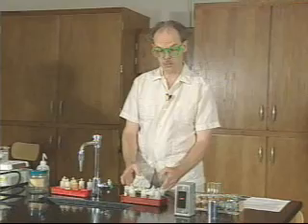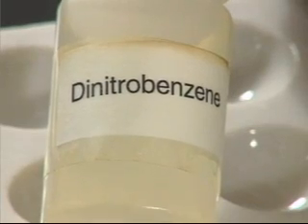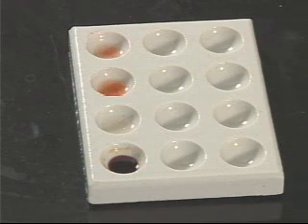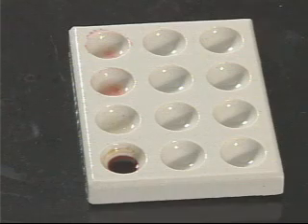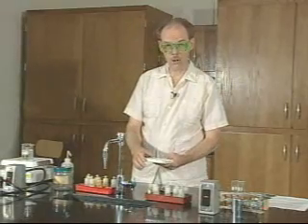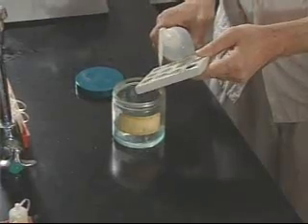At this point there will be no colors visible in your sample. Colors will appear after you add two drops of the dinitrobenzene reagent to each well: two drops in the first well, two drops in the second well, two drops in the third well, and two drops in the last well. For the dinitrobenzene, some of the wells will give a slight color change — you're only interested in a very intense dark purple stain, as we see right in front of us here. That would indicate a positive result in this test. When you're finished, be sure to record on your observation sheet what you see and then rinse this out into the waste container.